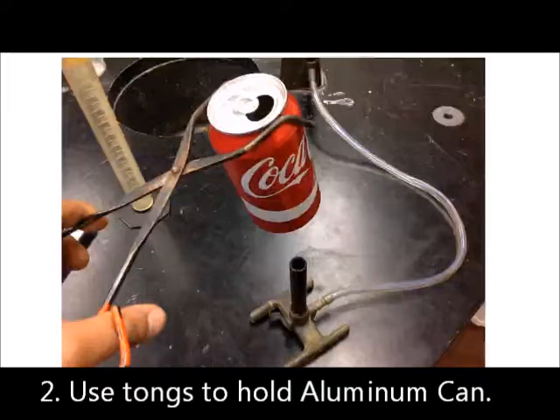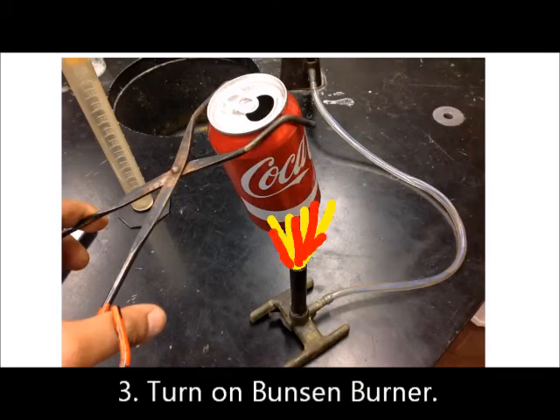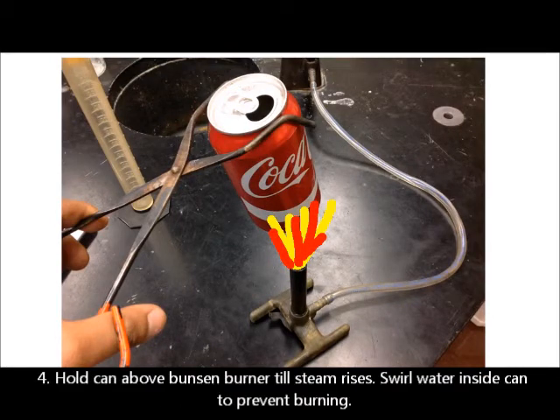the can. We're going to be heating up the can, so at this point we can turn on the Bunsen burner. We don't want to burn the can itself, we want the water to get warm, so we have to swirl it around. Once that happens, the water inside should start to boil, and you'll see steam coming out of the top.